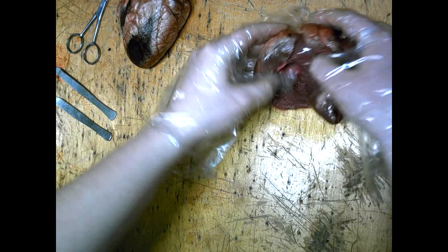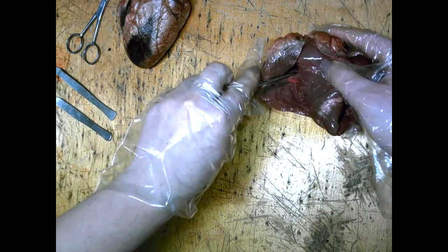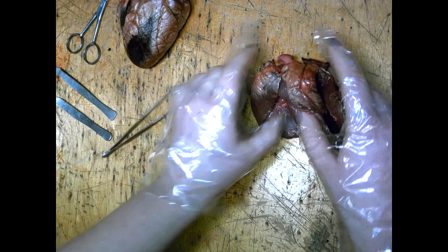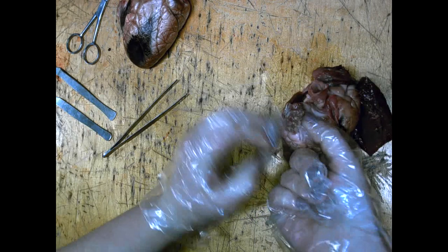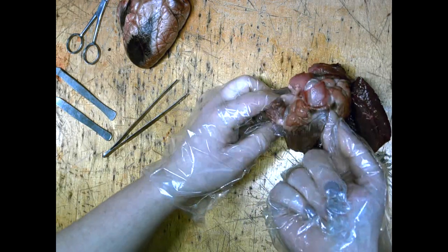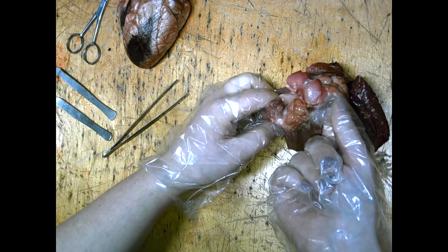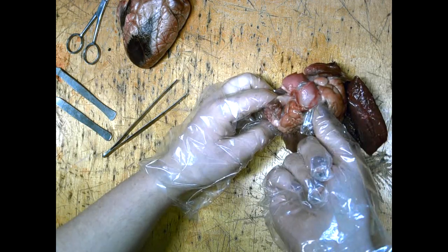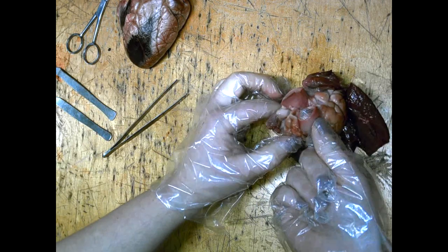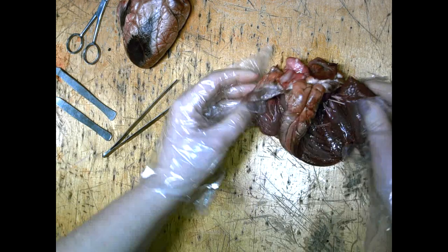Inside you have the valves that control the movement of blood from the atrium into the ventricle. You can also see at the top that you have the pulmonary artery taking blood from the heart to the lungs. Being an artery, the walls are thicker and more elastic because they are carrying blood under high pressure.